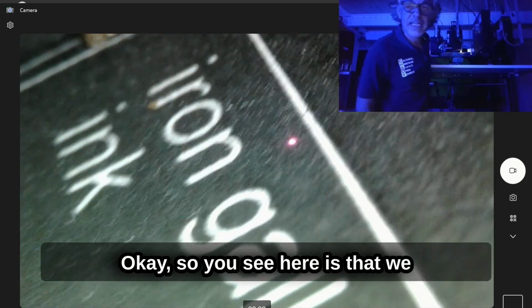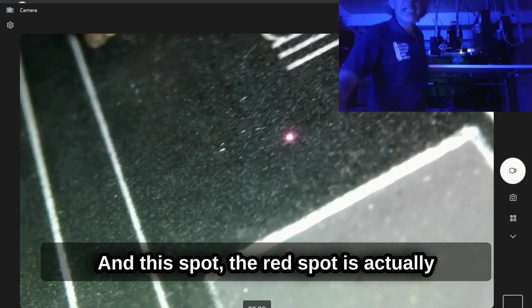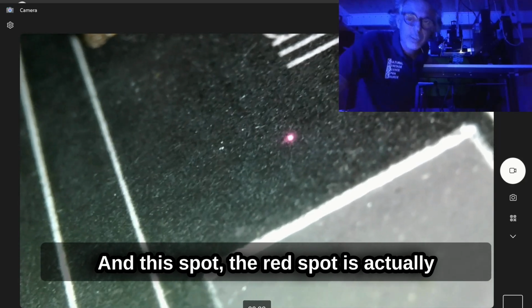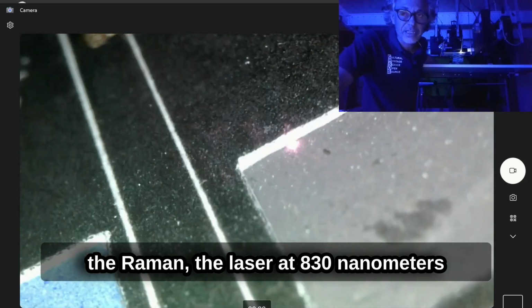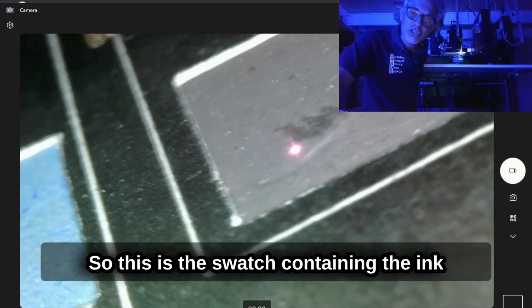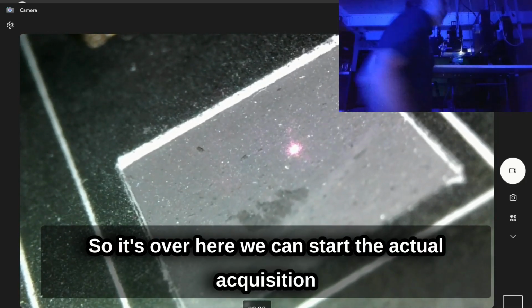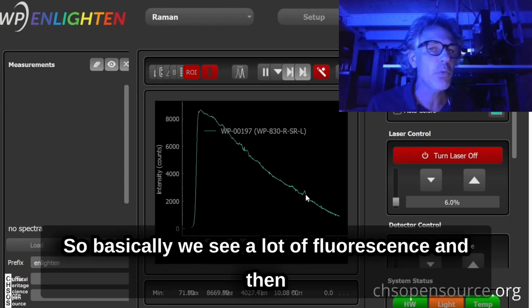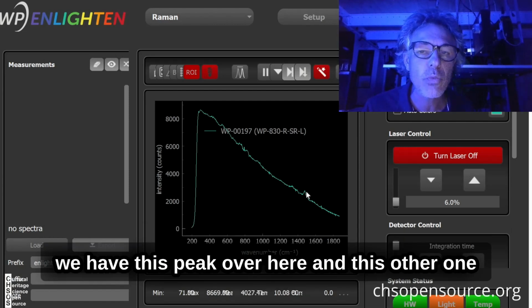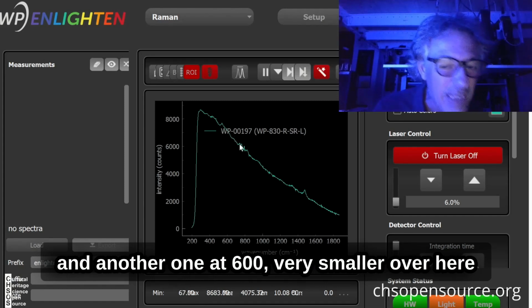Okay, so you see here we are seeing the iron Gall ink standard. This red spot is the laser at 830 nanometers. So we go over here. This is the swatch containing the ink, so it's over here. We can start the actual acquisition, and we start to see the signal of the ink. Basically we see a lot of fluorescence, and then we have this peak over here, and this other one, and another one at 600, much smaller, over here.